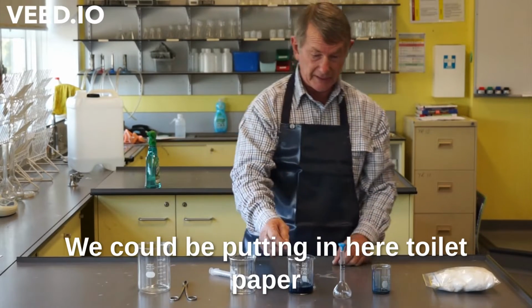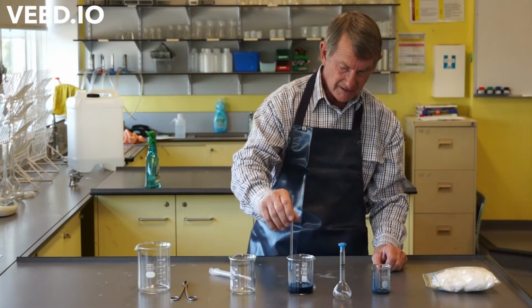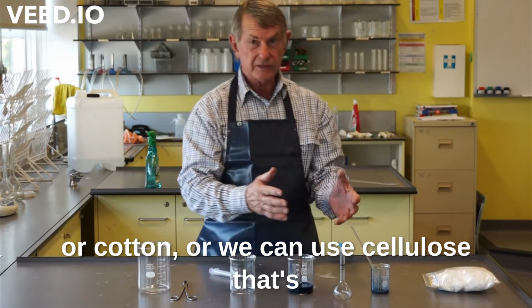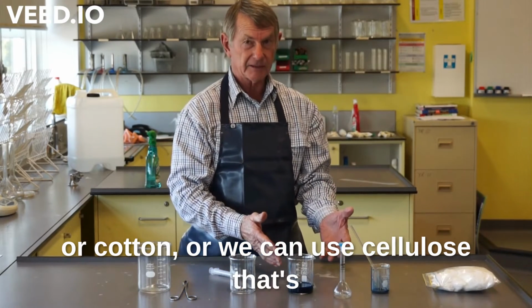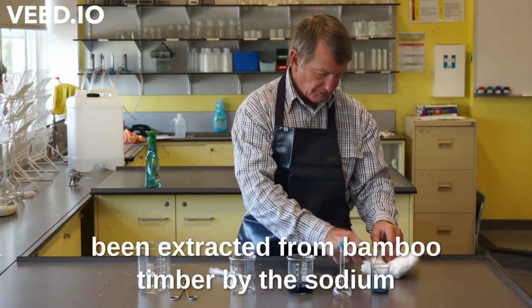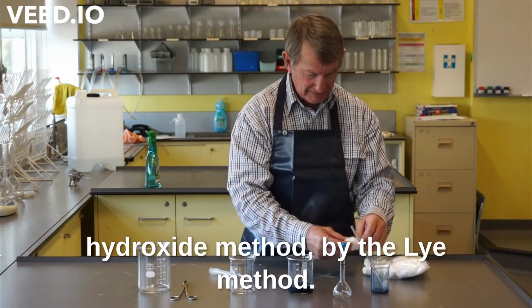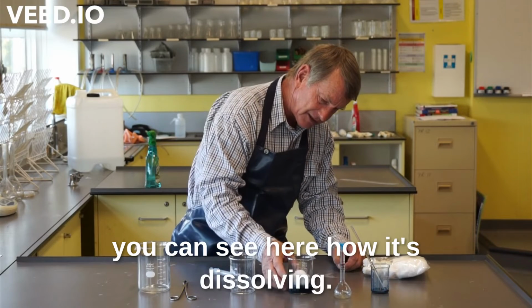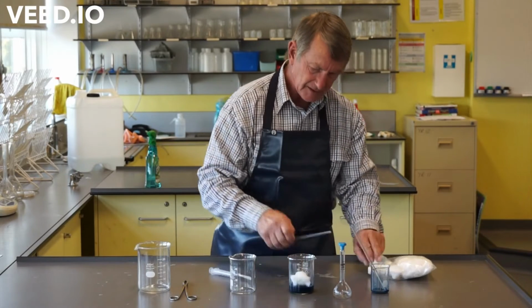We could be putting in here toilet paper or cotton, or we can use cellulose that's been extracted from bamboo timber by the sodium hydroxide method, by the lye method. But the easiest and quickest thing, and you can see here how it's dissolving.